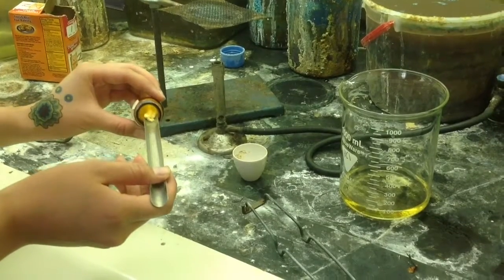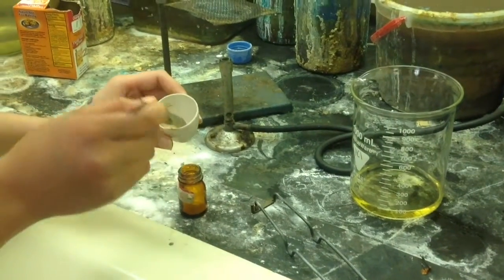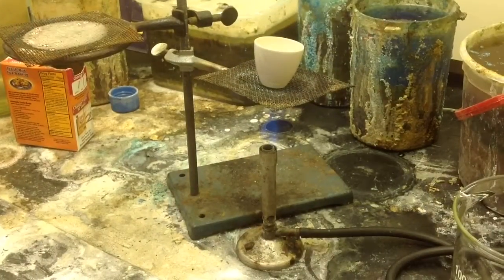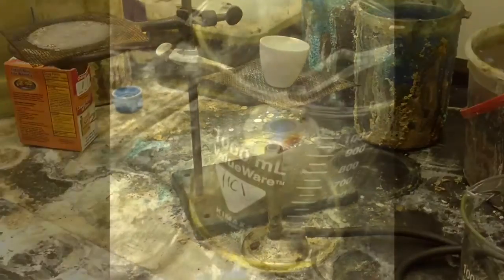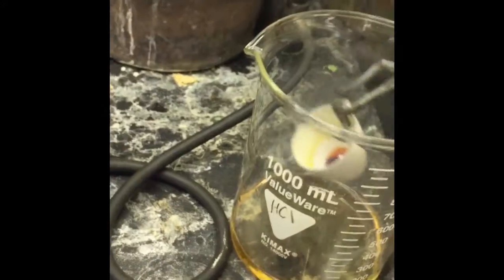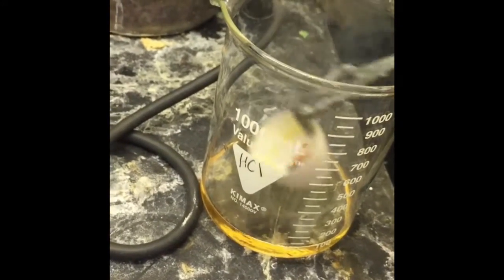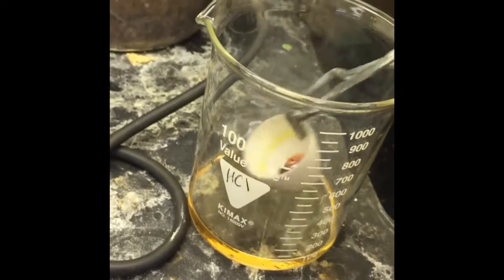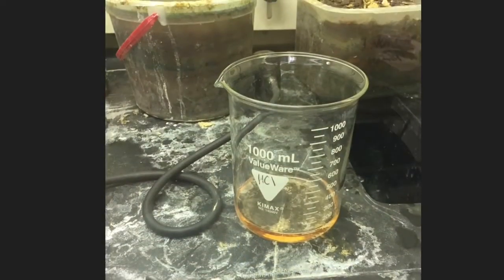Here, I'm putting a pea-sized scoop of sulfur into the crucible to heat. I continue by heating the sulfur until a blue flame comes off of it. I then lower the crucible into container 3. The solution gradually becomes more acidic, nearing the red end of the universal indicator spectrum as it goes from yellow to orange in color.